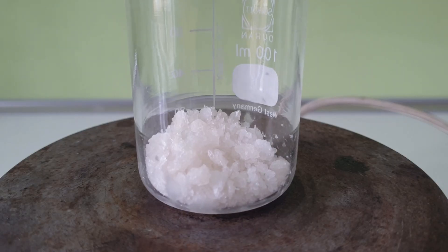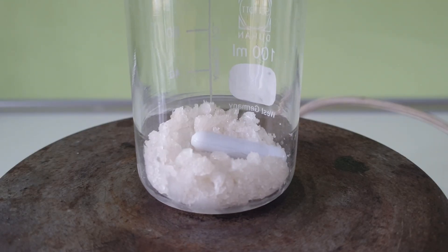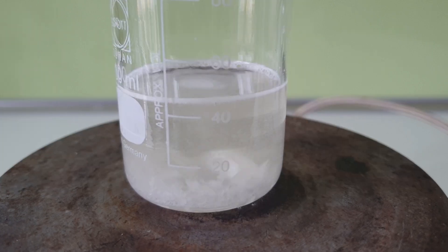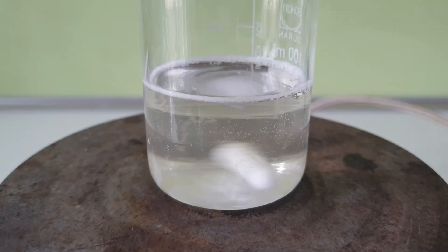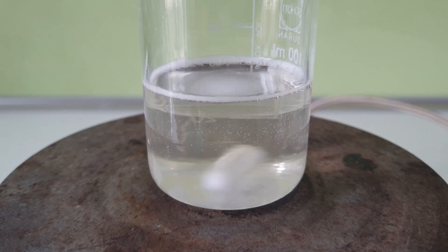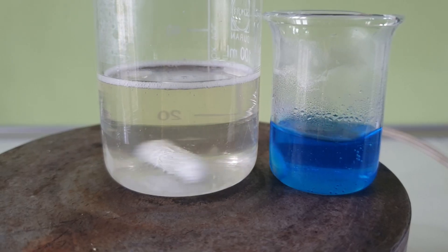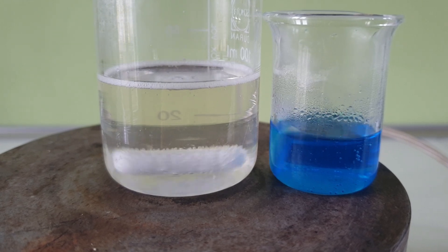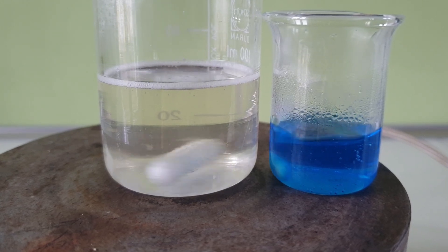In the meantime, I add 12.3 grams of potassium oxalate monohydrate to a large beaker and dissolve it in 35 milliliters of water. This represents a 2 molar excess of oxalate ions. After that, I place both solutions on the hot plate and heat them until they reach approximately 90 degrees Celsius.